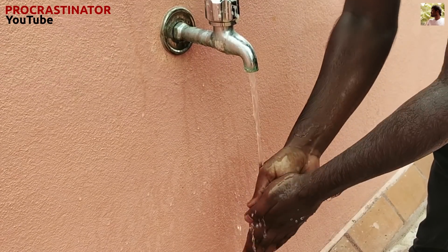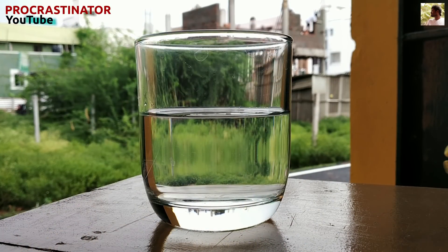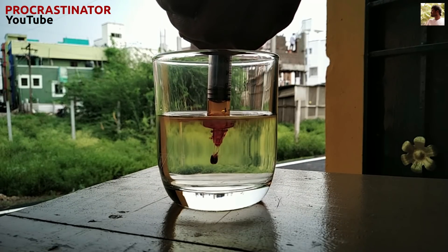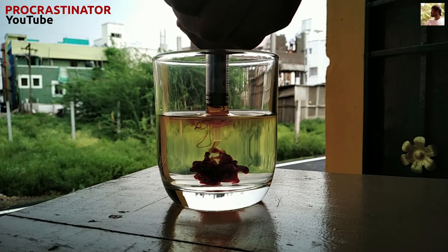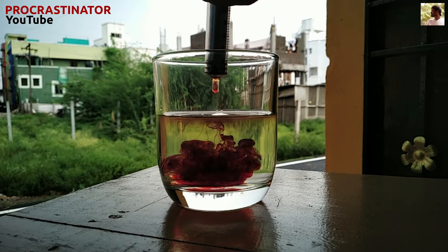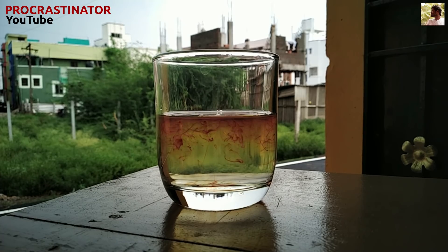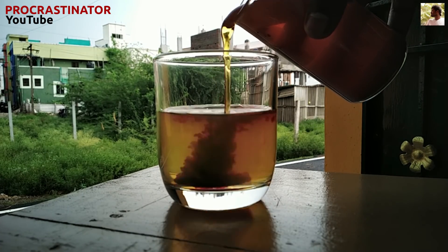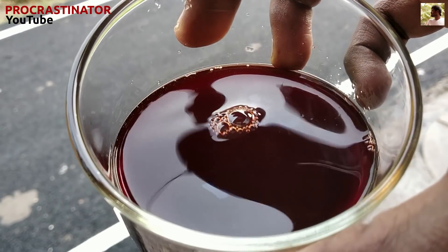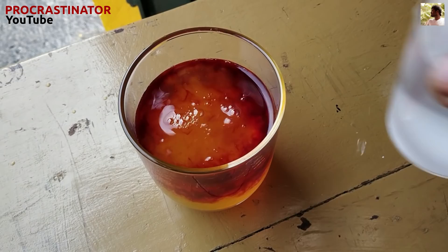Now I am using potassium thiocyanate solution in this glass. Let's put ferric chloride solution in this glass and mix. These are very red. If we add sodium fluoride to this red mixture, it will go from full red to a lighter color.